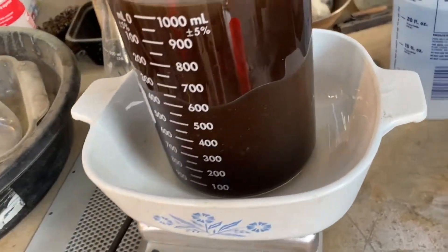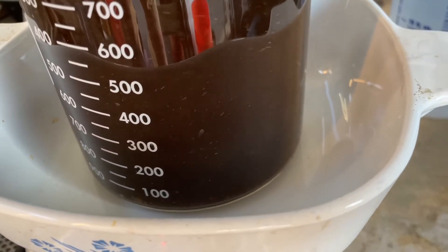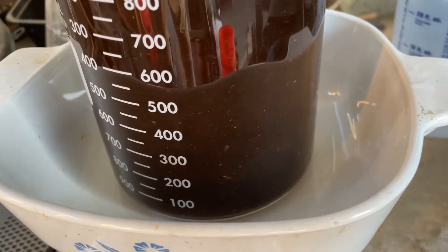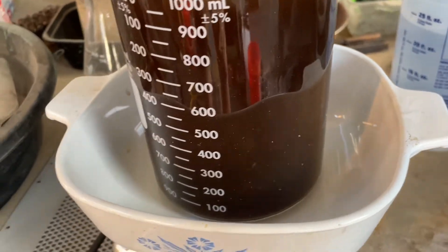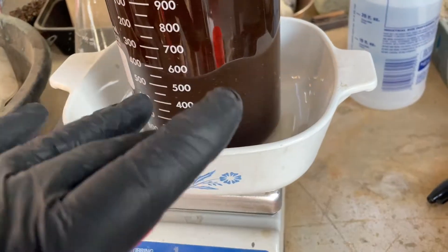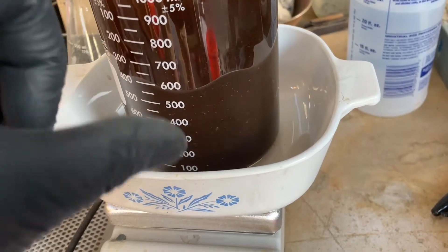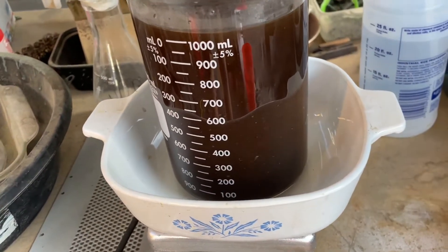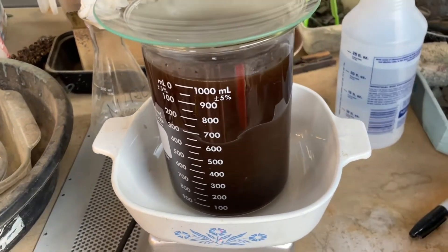It's been there for a little while. I can still see some pieces zipping by. I only have it up to about 80 degrees probably now, but I need to get it up to about 130. After that I think we can turn it off and let it settle. The black sludge at the bottom you don't want to use, so you pour off hopefully clear material on top and then stuff at the bottom you dispose of. Once you pour that off, you can utilize that for your stripping agent.